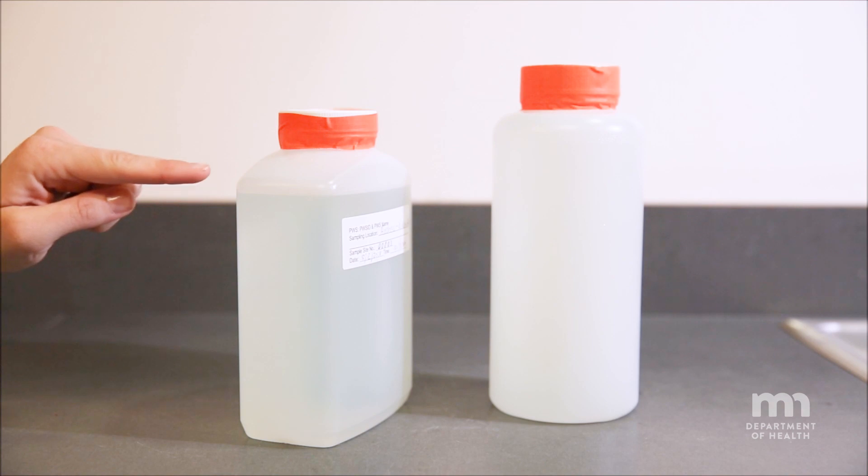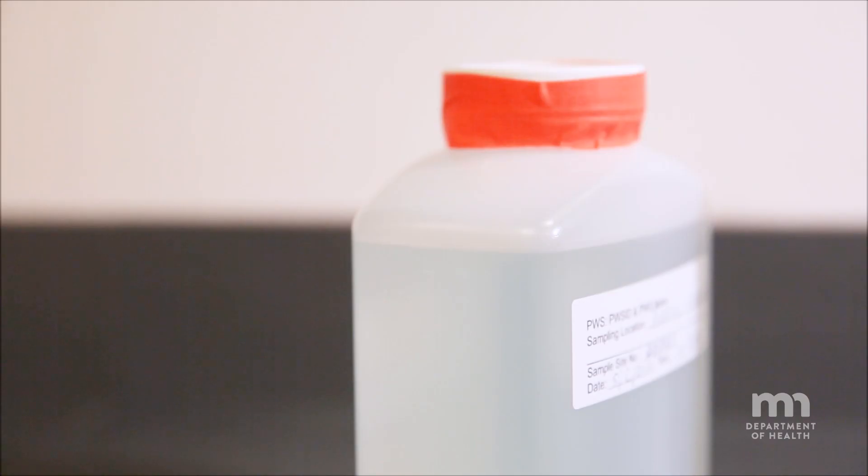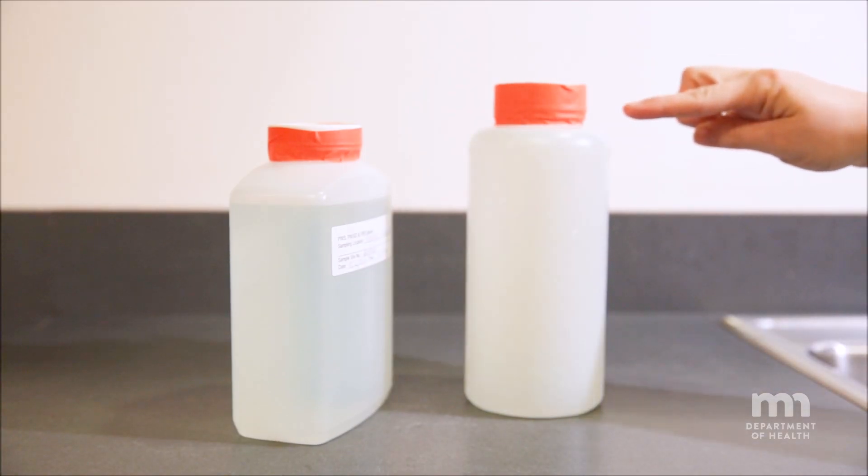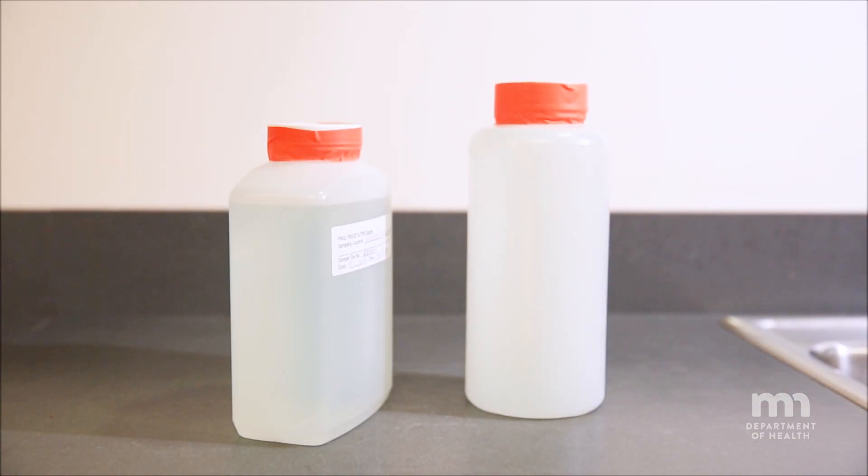If your bottle has a line, fill the bottle to the top line. If your bottle does not have a line, fill the bottle to the neck.